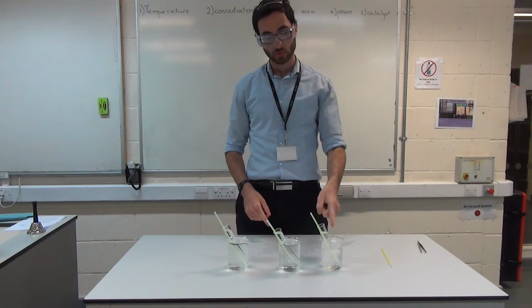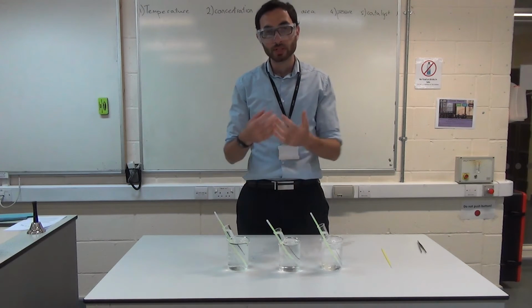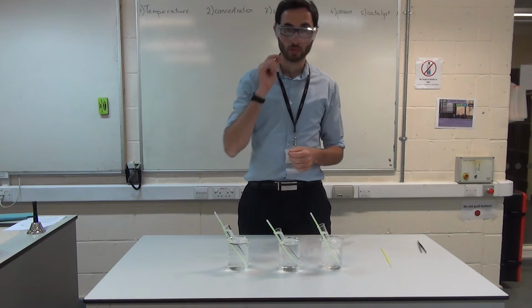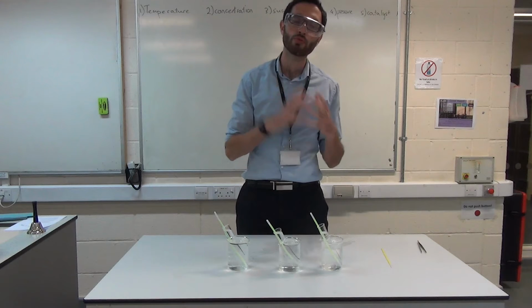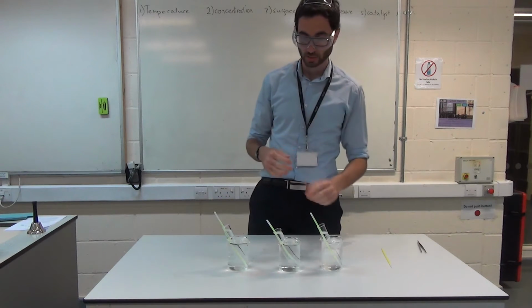Now over here, what you'll see is that the reaction is really slow. The reaction is still taking place, but it's really slow. Because it's so slow, only a little bit of light is being released. Because the collisions are infrequent. Every time they collide, they're releasing a bit of light, a bit of light, a bit of light. But because there are so few of these collisions, we're not going to get a lot of light overall. And hopefully, that's what we'll see.